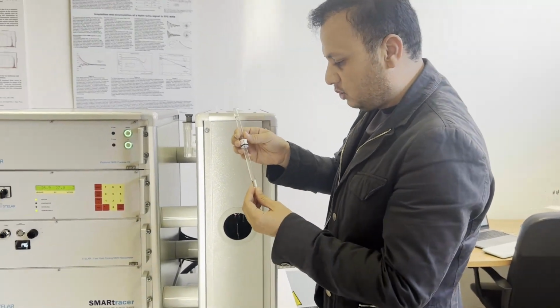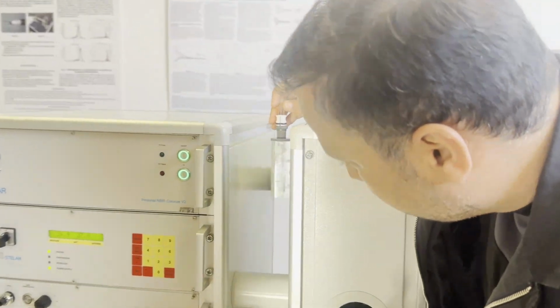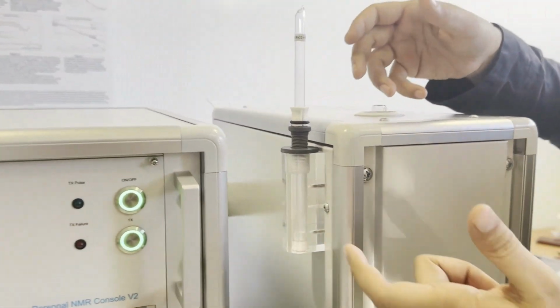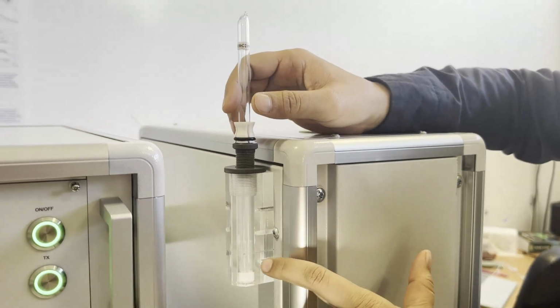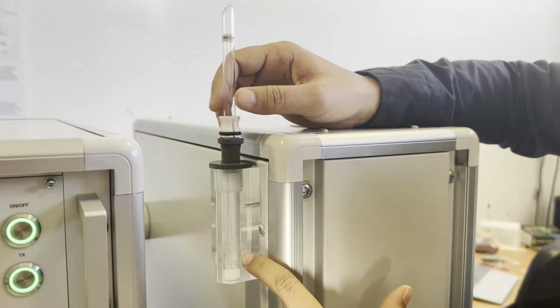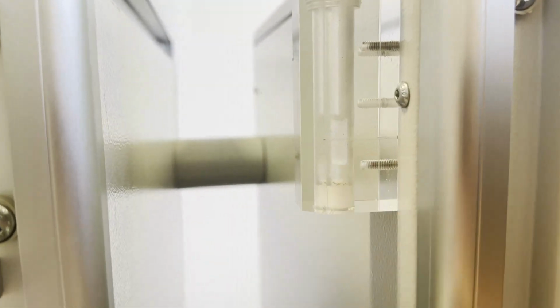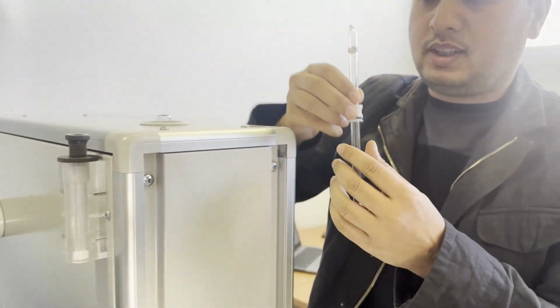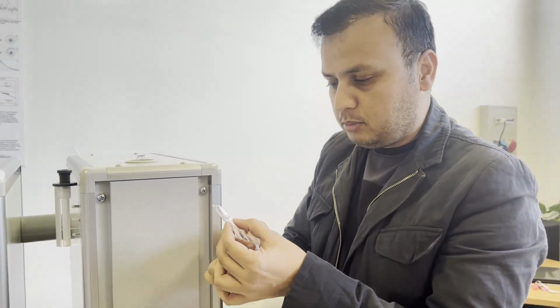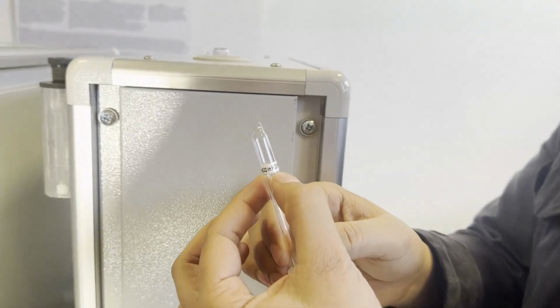The first thing to do is to always make sure that your sample is in the correct position. So we have this tool at SMARtracer. You have to make sure that the sample which you are measuring is exactly at center, which you can verify from this slide. Today, for our demonstration purposes, the sample which we will use is our standard sample, and this is 2 millimolar manganese chloride in 0.1% of HCl.